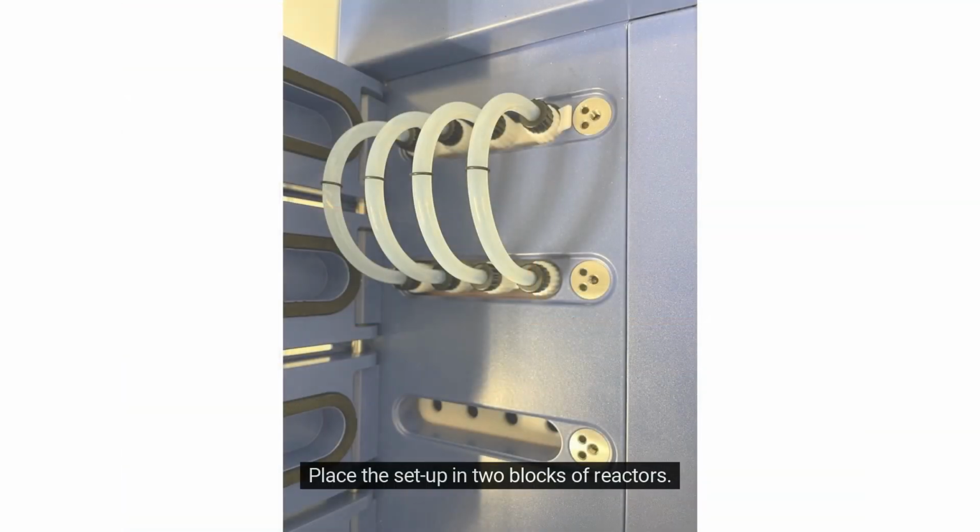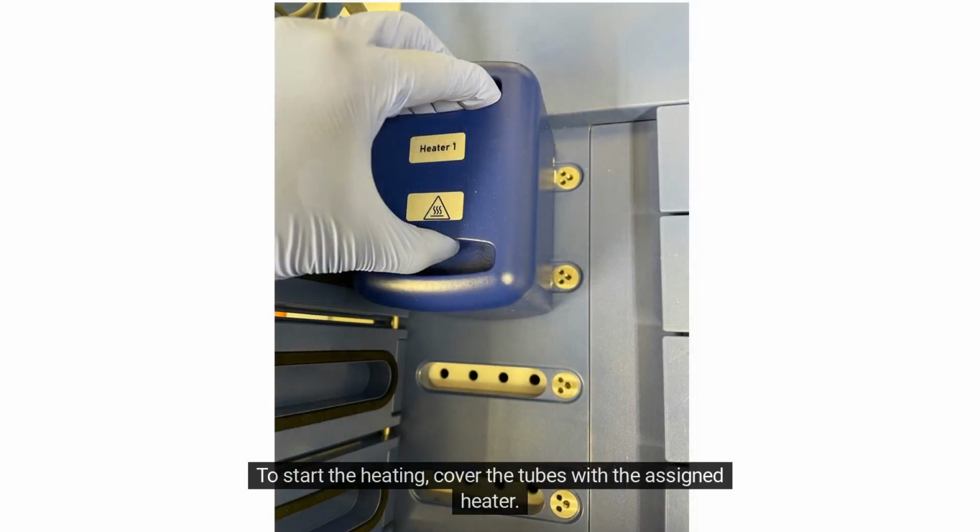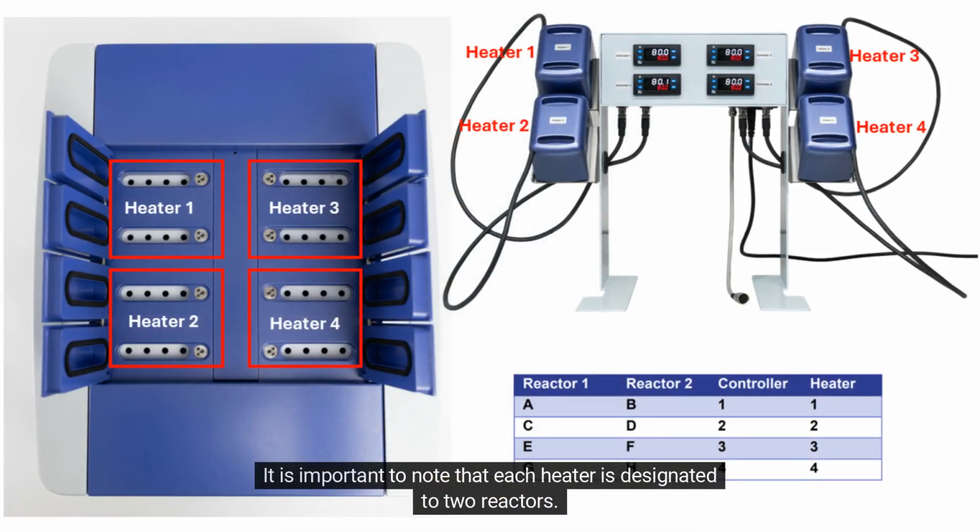Place the setup in 2 blocks of reactors. To start the heating, cover the tubes with the assigned heater. It is important to note that each heater is designated to 2 reactors. When an experiment starts from reactor A or reactor B, heater 1 will be turned on. The heaters and controllers are assigned according to the table shown.